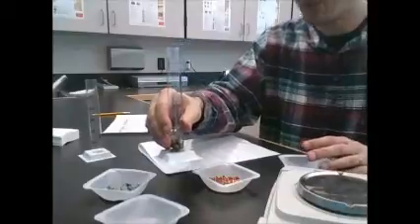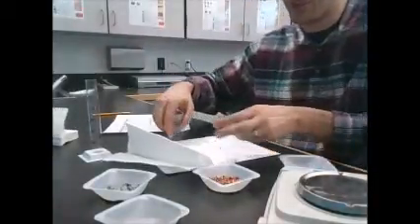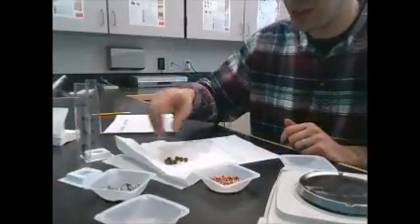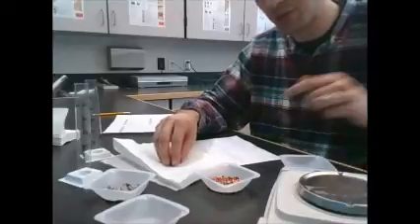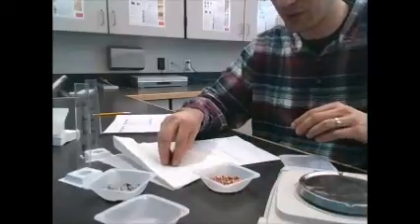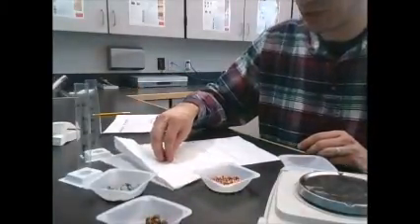Now they're going to be probably pretty wet, so I want to roll them out, not back into their regular tray, but onto some paper, kind of dry them off a little bit so the next group doesn't have a gross mess and sources of error of their own. Think about why it would be important to get the mass before getting the volume, especially when we're using water here. And we'll do that with each of these materials.